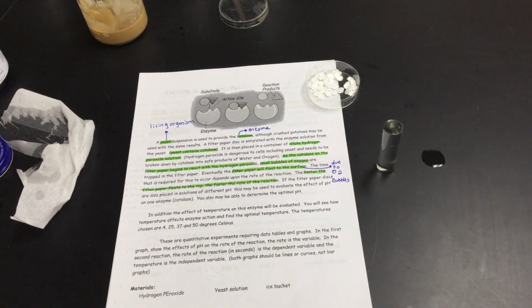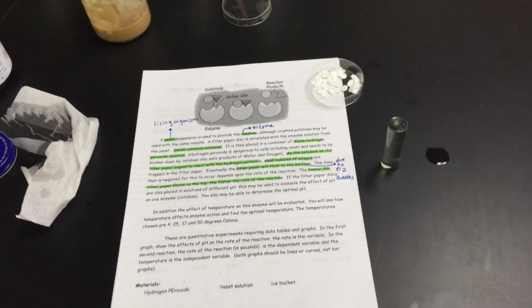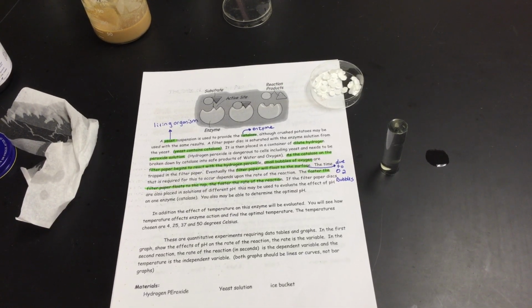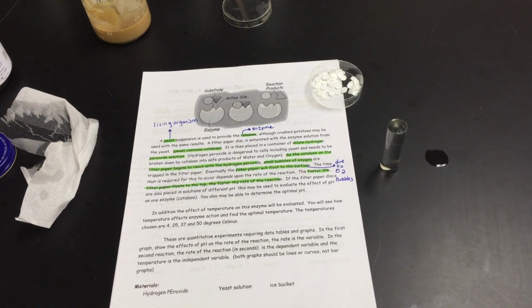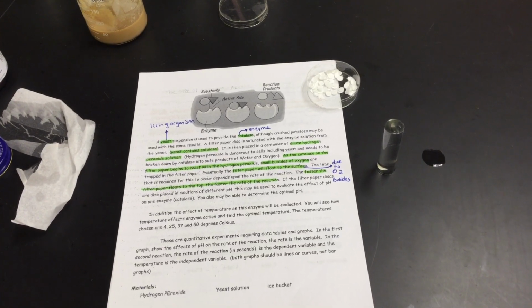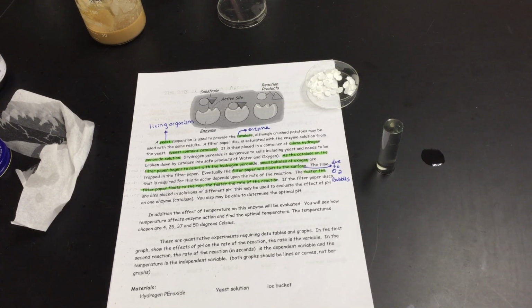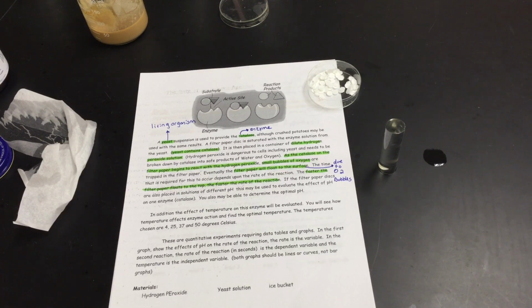And what we're looking for is for that catalase within the yeast that we just put on that filter paper disc to break down hydrogen peroxide. So remember, when it breaks down hydrogen peroxide, it's going to break it down into water. Well, we won't really know because my solution looks like water. But it's also going to produce oxygen, and that's the part that we're going to be able to measure. As it produces oxygen bubbles, those bubbles basically trap onto that little filter paper disc and it will raise it to the top. So the faster my reaction of that catalase breaking down hydrogen peroxide into water and oxygen, the faster that disc should rise to the top.